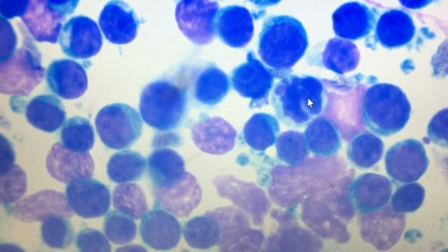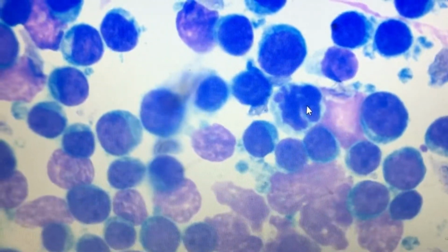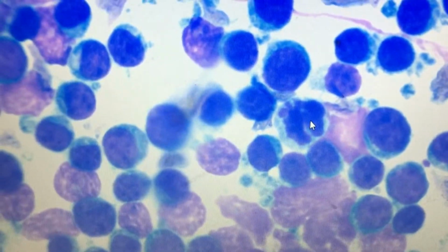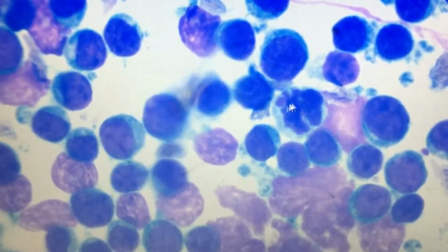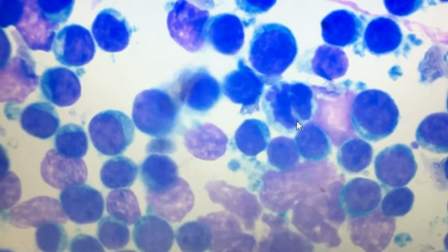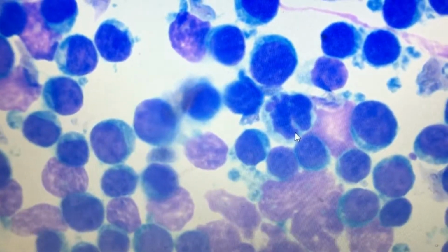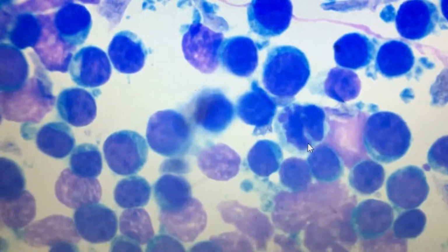But if you see mitotic figures in about 2 to 3 cells per 5 high power fields in 40x, then it is moderate. And a high mitotic index will have more than 3 mitotic figures per 5 high power fields. So in this way you can grade the mitotic index in cytology.